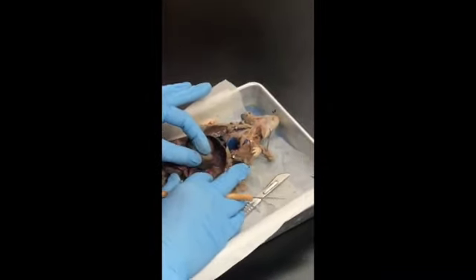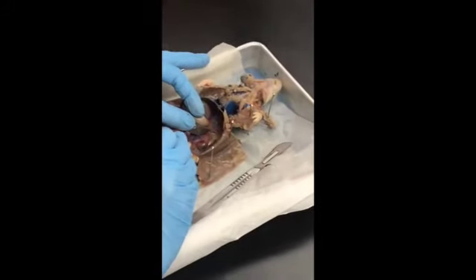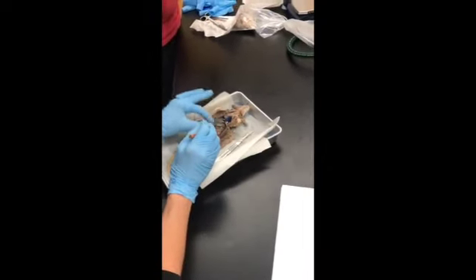And then on Tuesday, we'll kind of go in. You can see the renal arteries and veins running in on this rat. Make sure you know what all the functions are, okay, of all the parts of the rat, too.